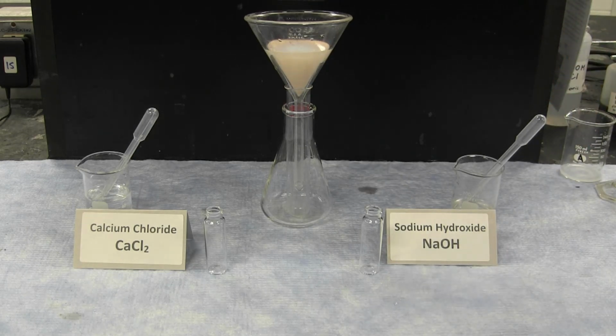By passing the reaction through the filter paper, all of the unreacted ions pass through the filter and are present in the filtrate, or the liquid that passes through. All of the reacted ions, including all of the limiting reactant, are contained in the precipitate, which is trapped on top of the filter paper. Once some time has passed and enough filtrate has been collected, we can perform a second set of experiments.